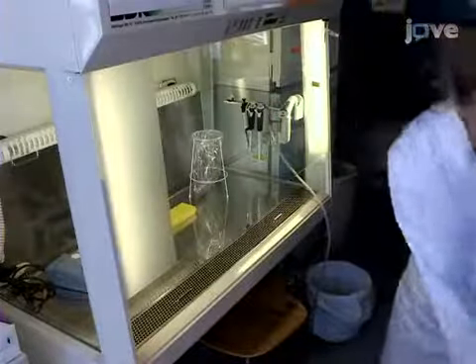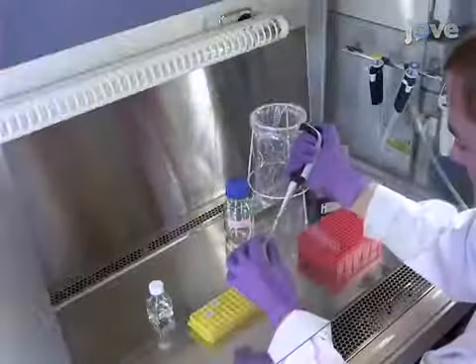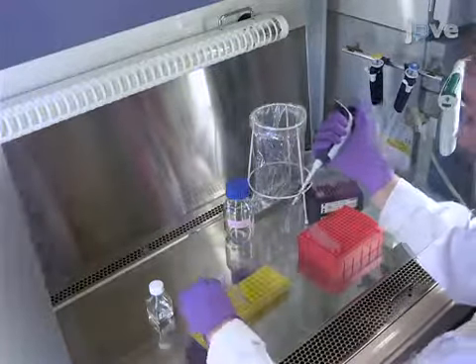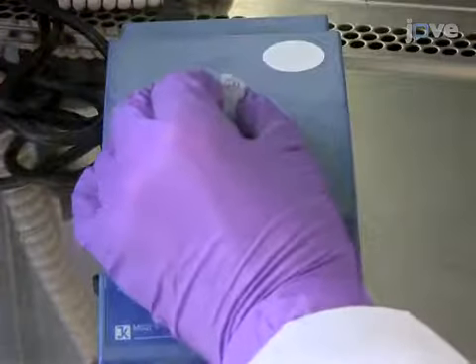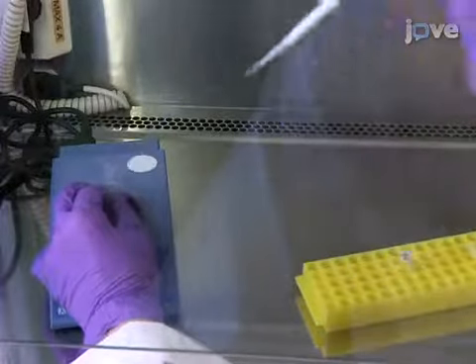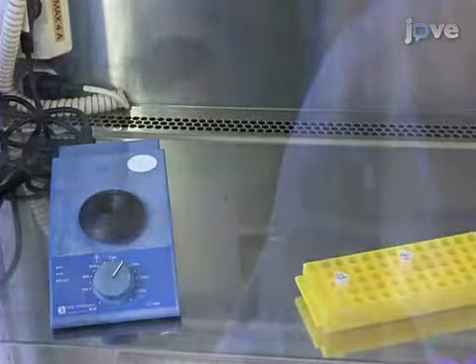All of the following steps should be performed under the appropriate biosafety conditions for adenovirus infection. To prepare linearized vector for cotransfection, transfer 6 microliters of jetPEI reagent into 94 microliters of 150 millimolar sodium chloride. Vortex briefly. Then, while vortexing, add the mixed solution to 100 microliters of linearized adenovirus vector. Incubate this transfection mix for 15 to 30 minutes at room temperature.